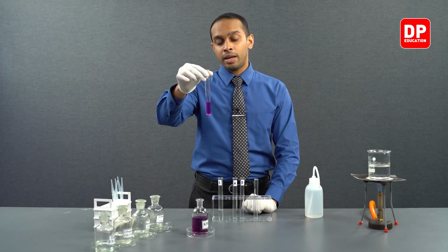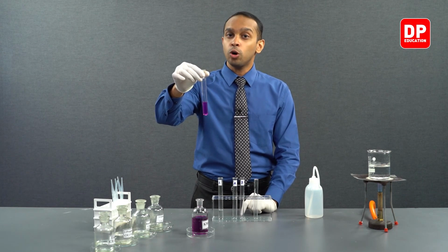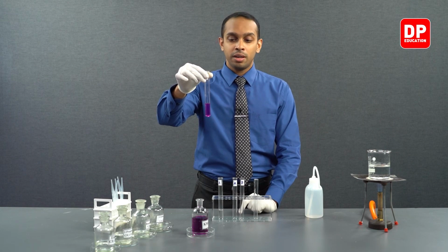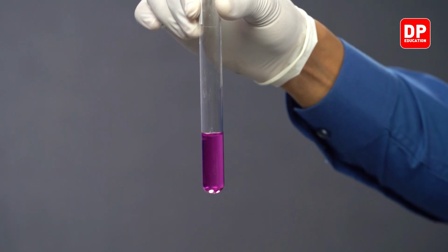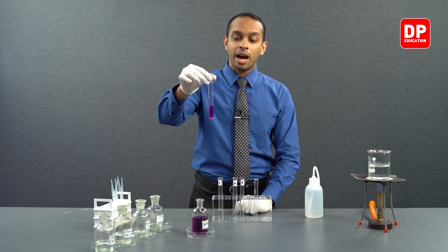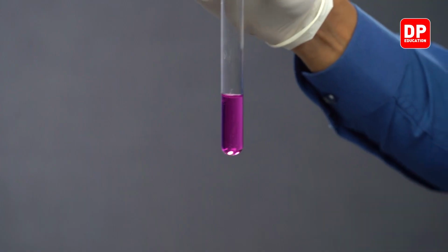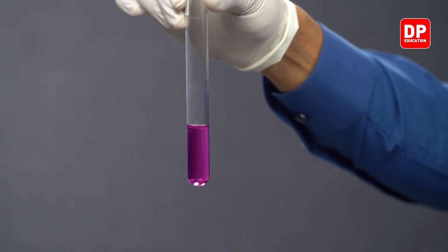It could be that acetone does not react with potassium permanganate, or the reaction is slow at room temperature, so you do not see a drastic color change. To avoid having a doubt about that, we will heat this reaction mixture to see if this reaction takes place at a higher temperature. If it does not decolorize at that point, we can be sure that in the presence of acidified potassium permanganate, there will be no reaction with acetone.